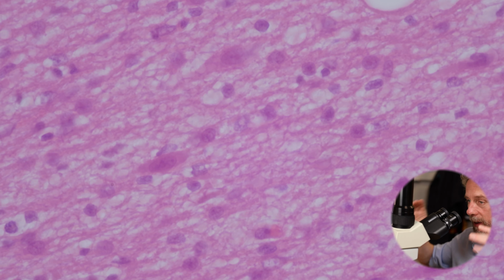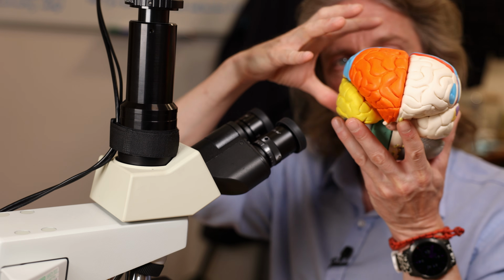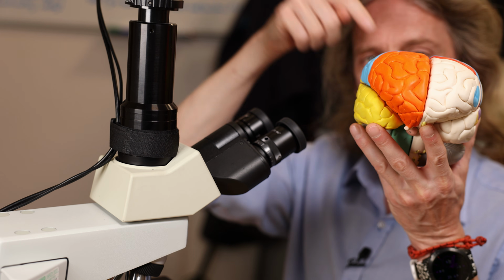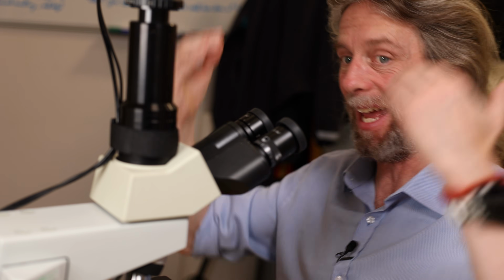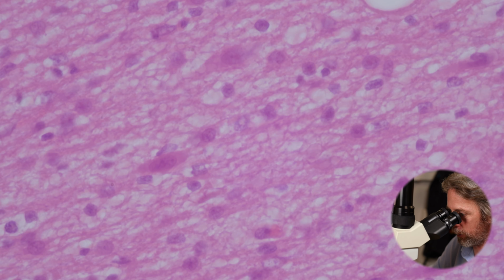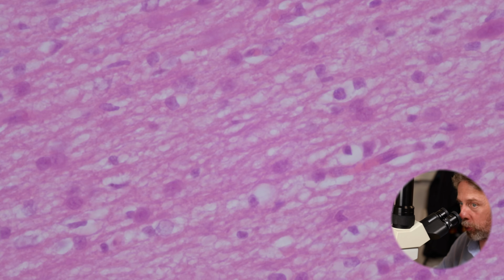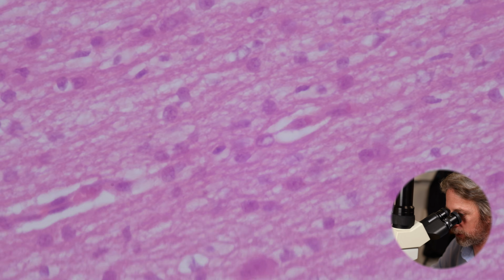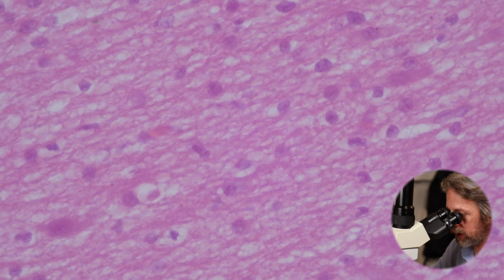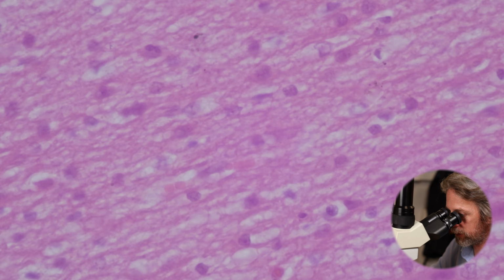And the white matter is in the center. Like I say, the grey matter is around the outside, and that's where we have the neuron cell bodies. So then the white matter is running through the center of the brain to get down the brainstem and off to wherever it's going. So the white matter is in the middle. And we see the opposite in the spinal cord. We see the grey matter running down the middle and the white matter running around the outside. So this is all white matter. So these are axons running across the screen, and the other cells we see there are the same glial cells supporting them.